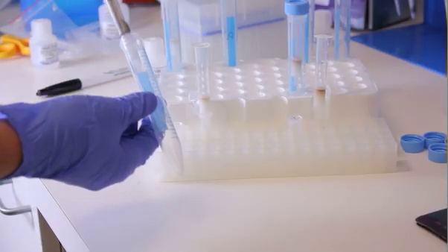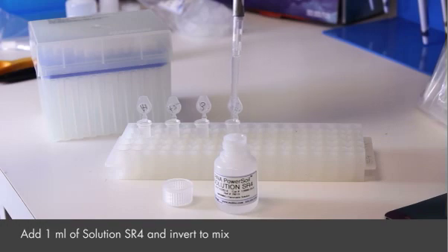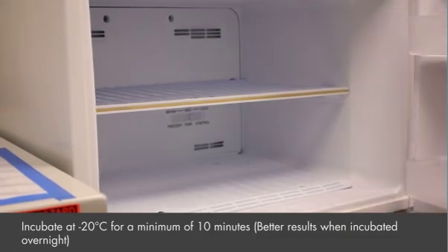Transfer the eluted RNA to a 2.2 ml collection tube. Add 1 ml of solution SR4. Invert to mix and incubate at minus 20 degrees centigrade for a minimum of 10 minutes.